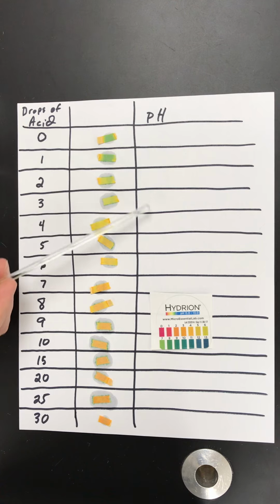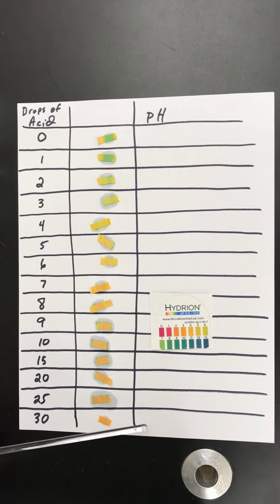Then you're going to go through and record all the different pH values and enter them into your data table. The procedure was the same for the water, the liver, the potato, and this other buffer solution. You'll compare how the rates of change of pH in those solutions compared to this one. So there's your basic procedure of the acid-base buffer lab.